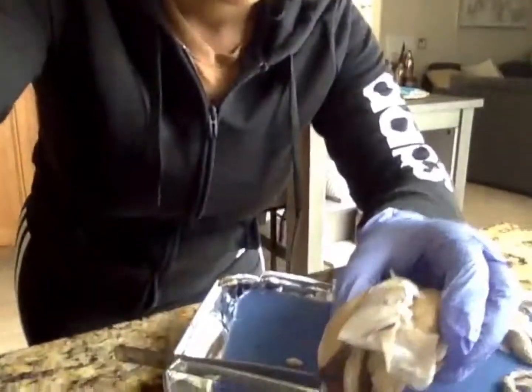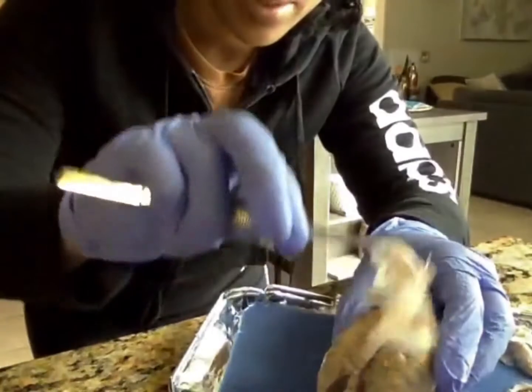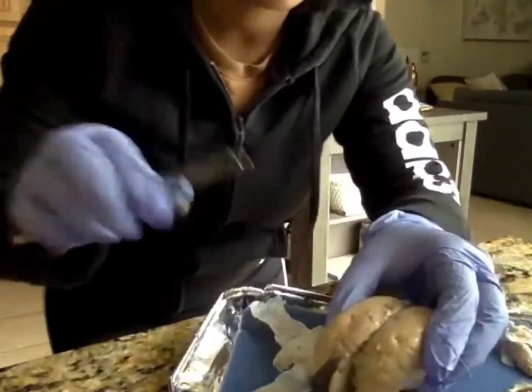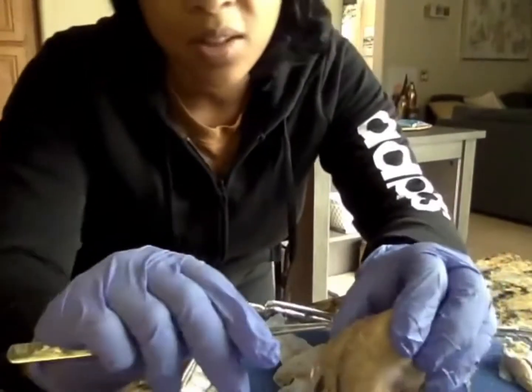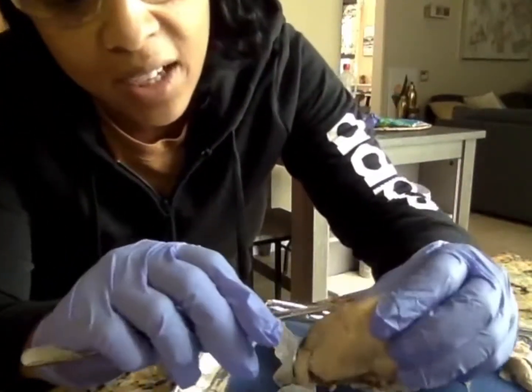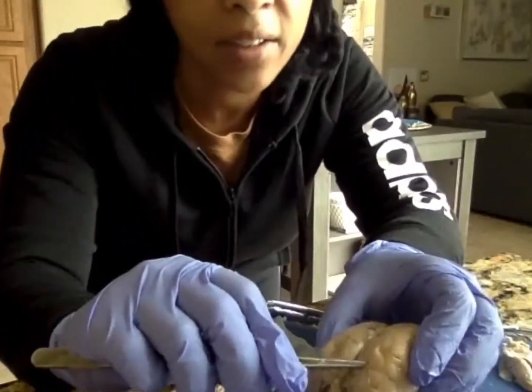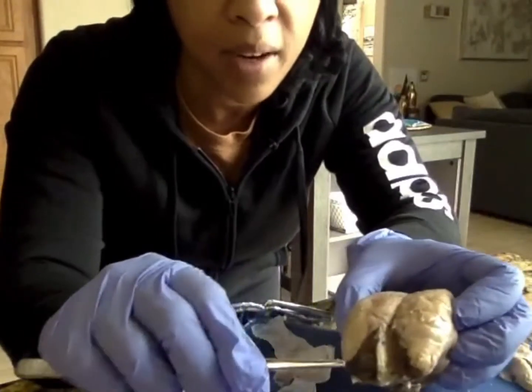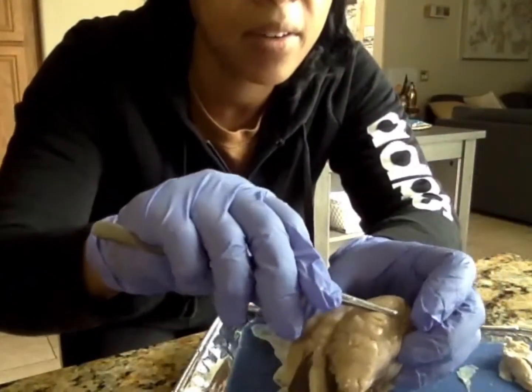So let's start. I kind of got a head start and already peeled off my meninges layer, which is here, so we could better see the brain. Of course, let's start with the sulcus groove, which we can see as the darker parts lining the sheep brain. The gyrus ridge is here. We have our frontal lobe, left and right. We have our temporal lobe, which is back here.